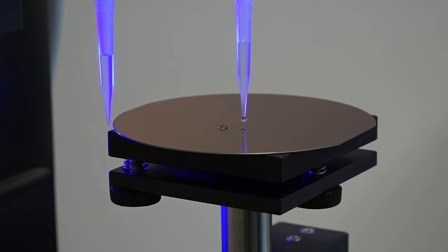After this droplet has been analyzed, again the sample stage moves to its next position, enabling mapping of the entire surface if needed.